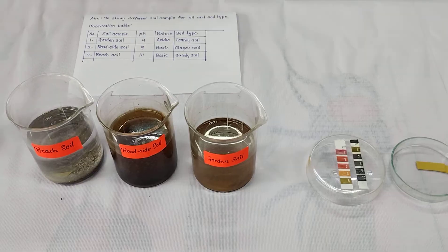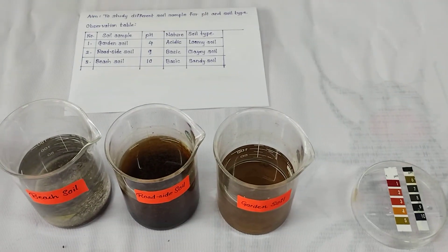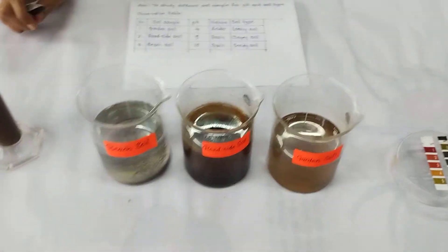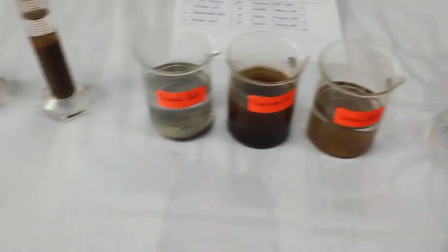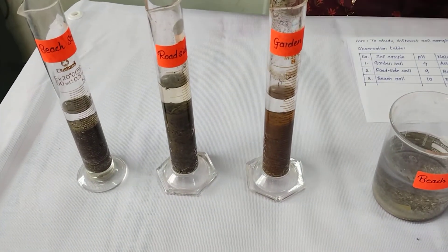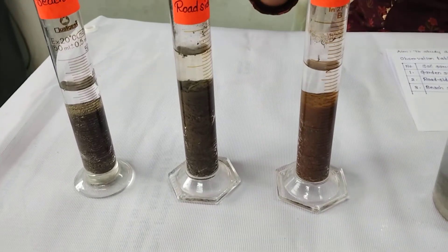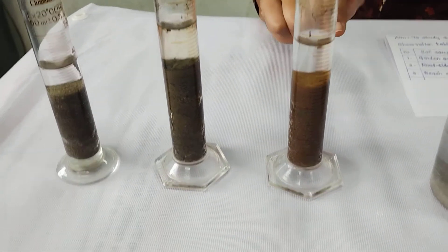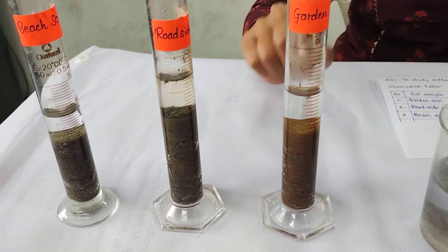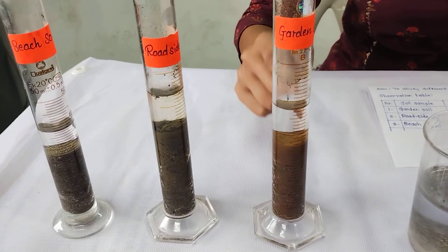That's why the nature of the beach soil sample is basic. Now this is all about the pH. Now we are going to study the soil type. The first sample is garden soil. In garden soil, we can observe that the amount of silt and amount of sand is equal, that's why garden soil is loamy soil.